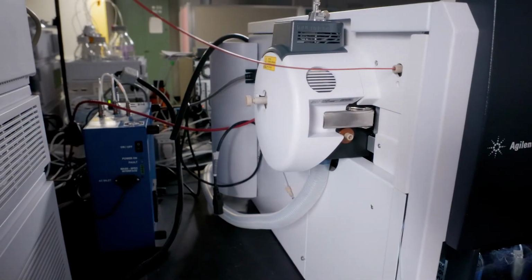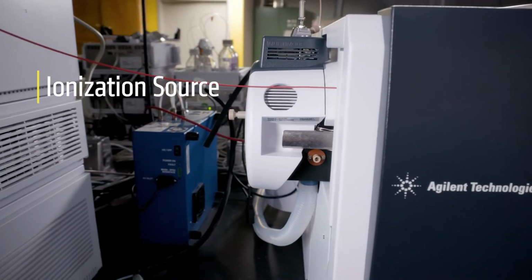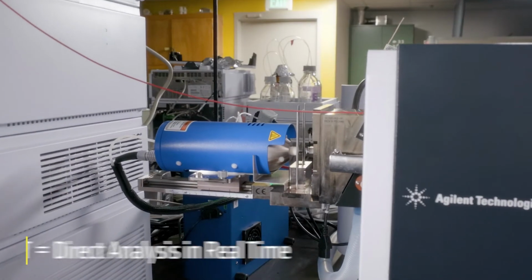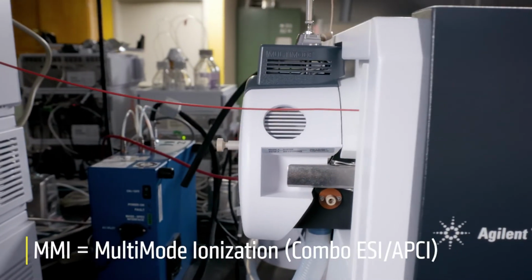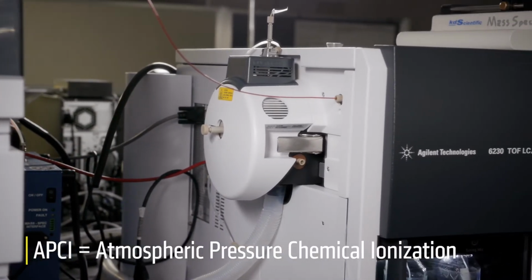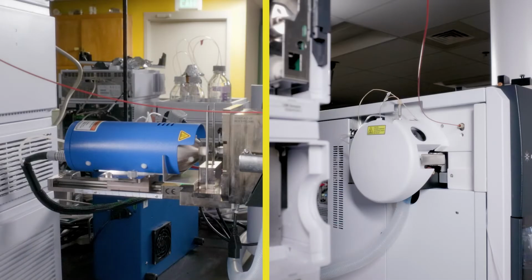The next major component is the ionization source. We have three different ionization sources that are compatible with this instrument: electrospray ionization, or ESI, direct analysis in real time, or DART, and multimode ionization, or MMI, which is a combination of both ESI and APCI. APCI stands for atmospheric pressure chemical ionization. The ESI and DART sources are used most frequently on this system.